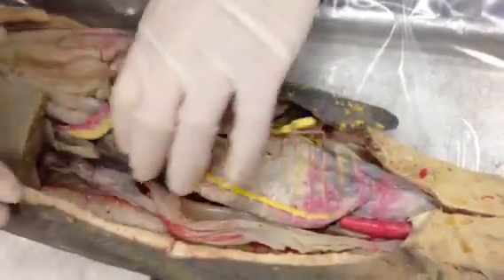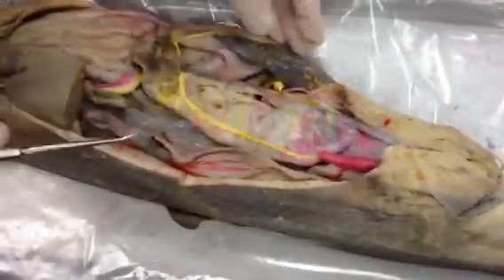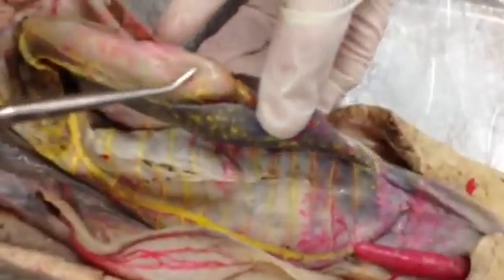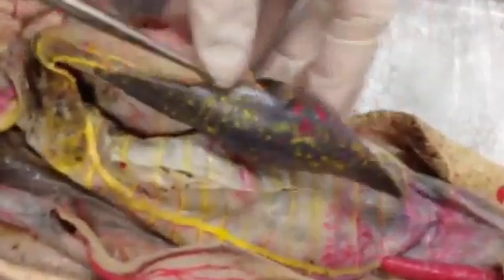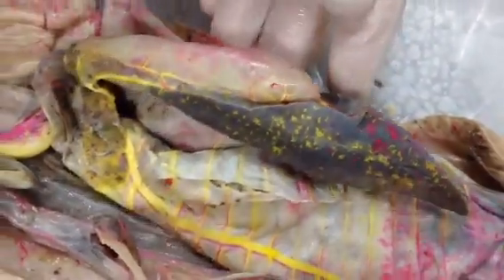The one that connects the esophagus and stomach underneath here is the greater omentum, or the mesogaster. The dorsal mesentery that connects to the digitiform is the mesocolon, and you can see it connected to the digitiform gland here as well. For the gastrosplenic ligament, which is also mesentery — just think stomach and then spleen — it's the mesentery between the two of them.